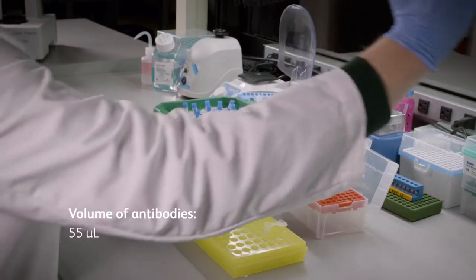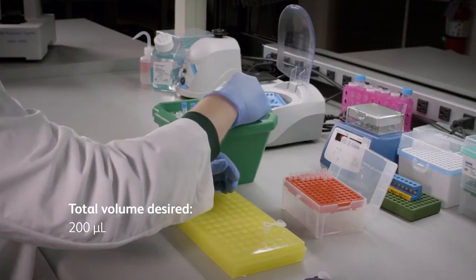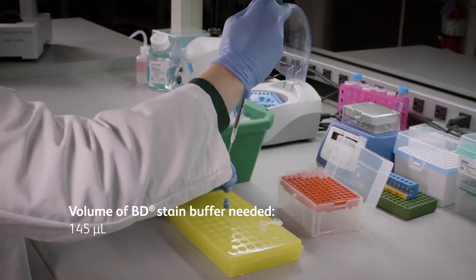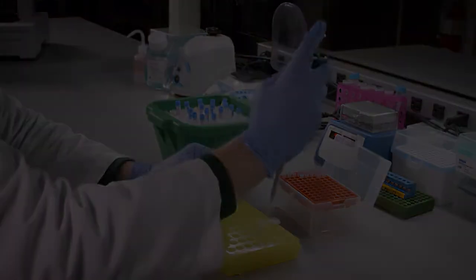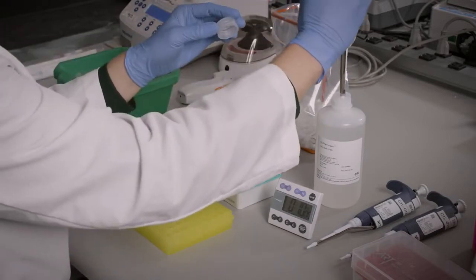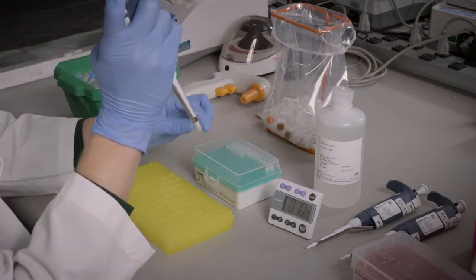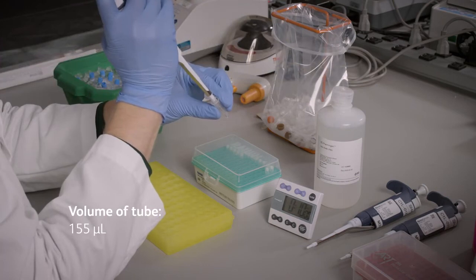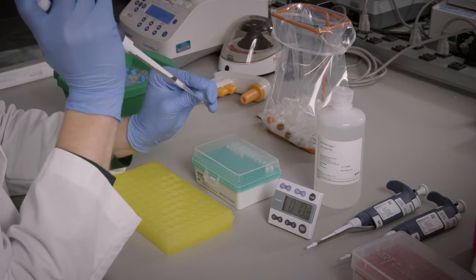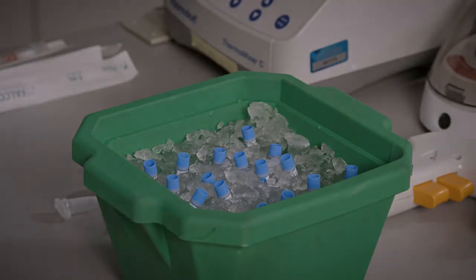Next, we'll subtract this total volume of antibodies, 55 microliters, from our desired volume of 200 microliters to obtain the volume of BD stain buffer that will be used during staining. In our case, we will need 145 microliters of stain buffer. If your cells are not in the appropriate volume or buffer, pellet them and then resuspend the cells in BD stain buffer. In our example, we will add 145 microliters of BD stain buffer and the 10 microliter pool of the shared clones. Remember, in our example, we had 8 microliters of flow antibodies and 2 microliters of BD AbSeq antibodies in our pool. Then, pipette mix and incubate the cells for 10 minutes on ice.